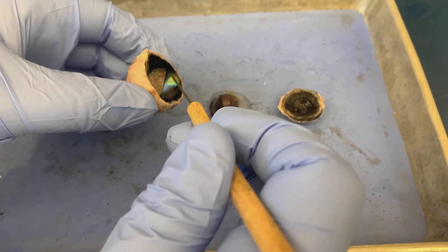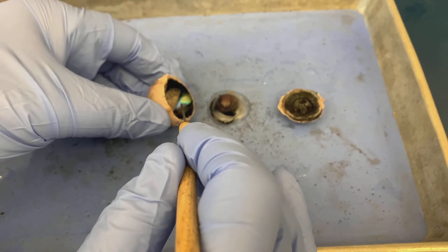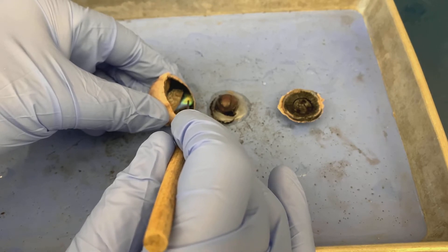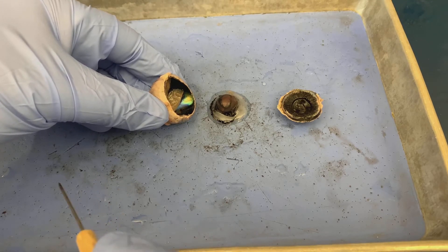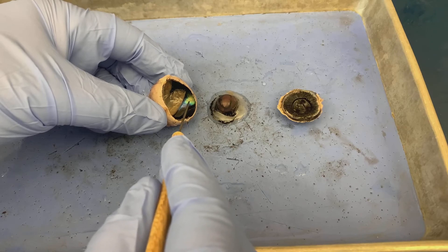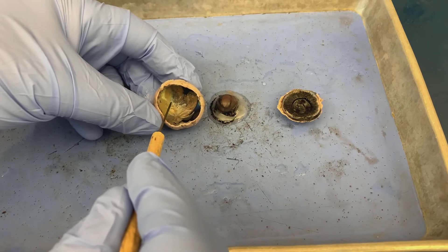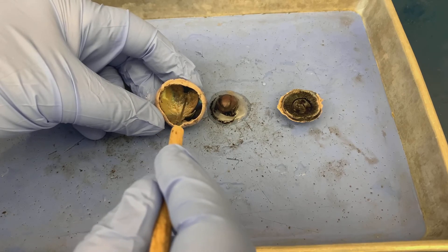Now if we look here, you'll see this discolored portion that looks almost iridescent, almost like a mother of pearl. This is known as the tapetum lucidum. The tapetum lucidum is a structure we see in some other mammals and vertebrates — we don't have it ourselves, so it is not a human structure and you're not required to know it. This very thin, wrinkled, brownish or pinkish layer here — which is a bit fragmented — is known as the retina. This is actually the retina and it's very delicate.